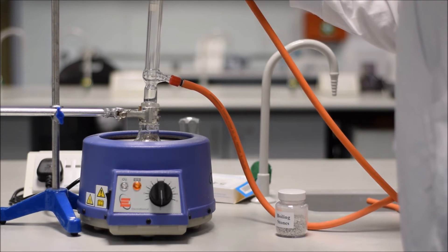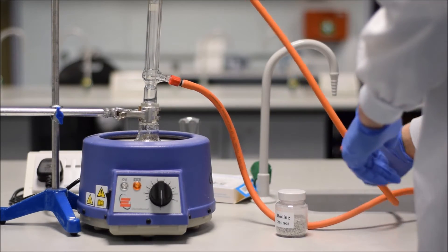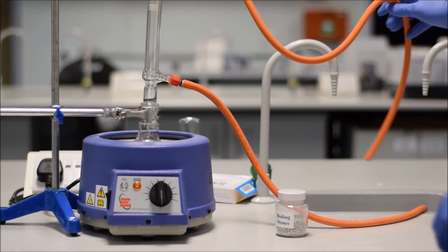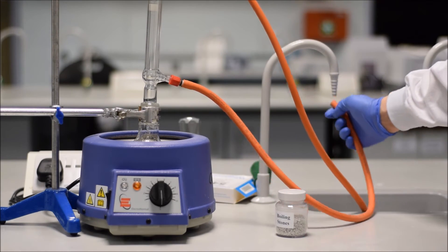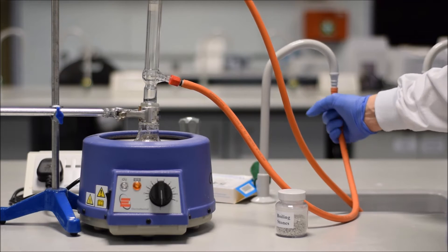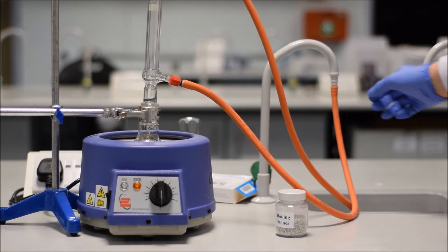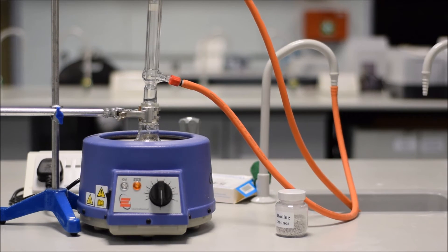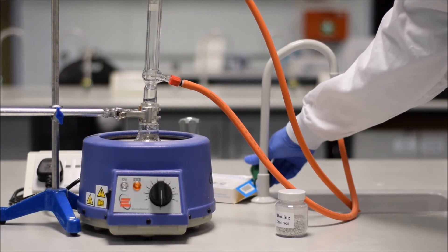It's important to have the water flowing before you start the heat, for obvious reasons. How much water do you need to have flowing through? The answer is, less than you'd think. Water is a very effective absorber of heat. The specific heat capacity of water is really quite high compared to other solvents. So really just a trickle, and not the Niagara Falls. There's no point in wasting water here.